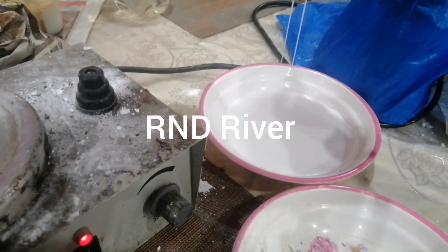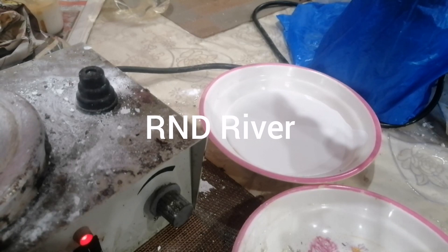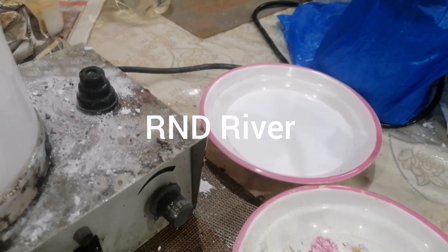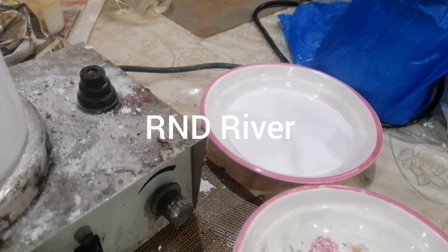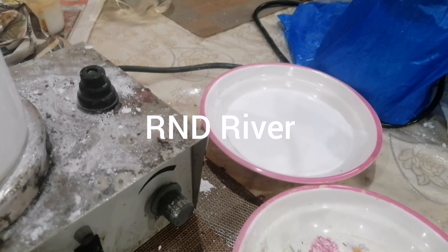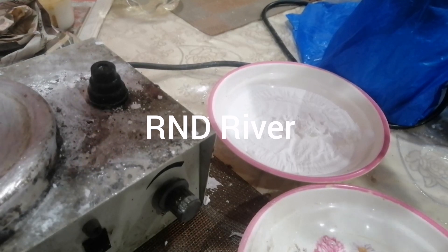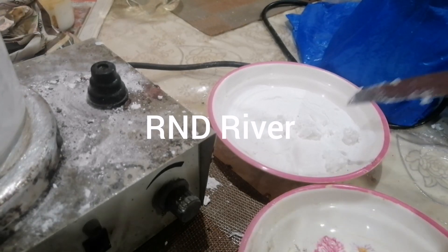The zinc stearate is near to finish and the moisture has been dried. Due to the solid state, it will melt again momentarily, so we need to allow a little time for drying of this product. As the product dries, it will become a powder shape.